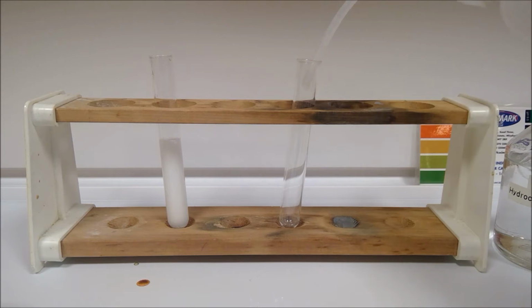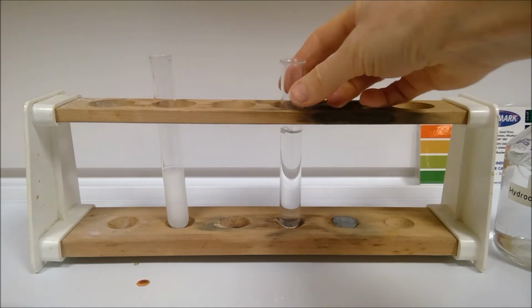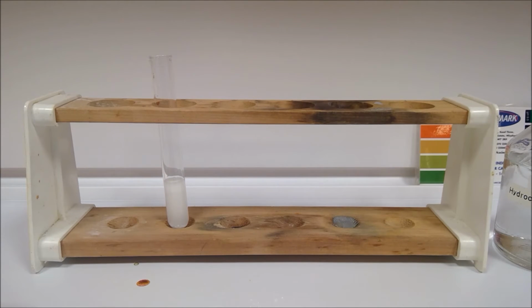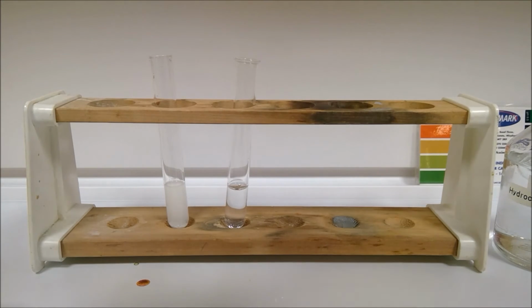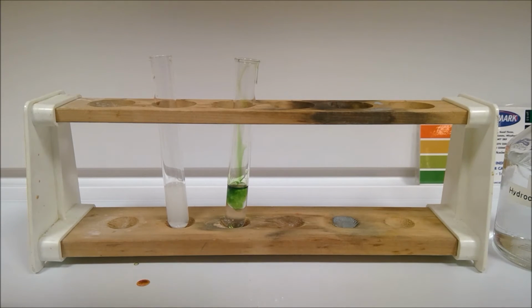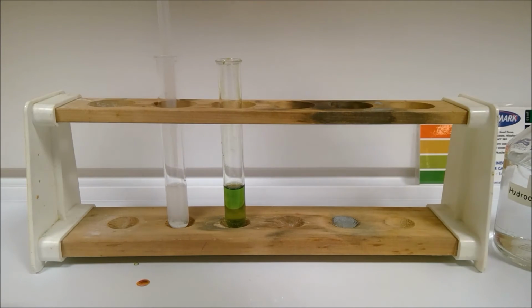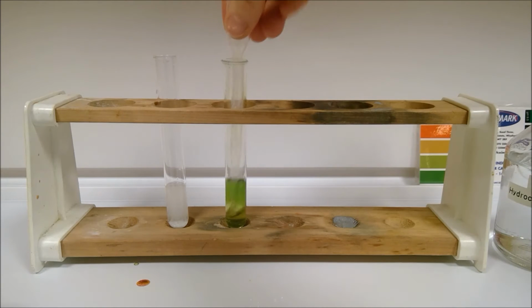Right, we're going to capture this gas and then bubble it into some distilled water. Take a little bit out of there. That has some universal indicator in, and we'll see what happens. Okay, now when we're trying to collect our gas here, if I just now suck up over the surface of the solution, this test tube is going to be nice and full with the gas from all that whooshing before. So we should now be able to squish this up and down, and then look at that.